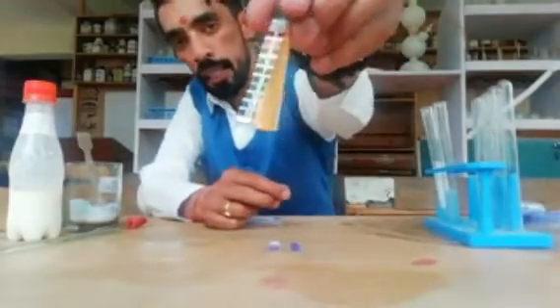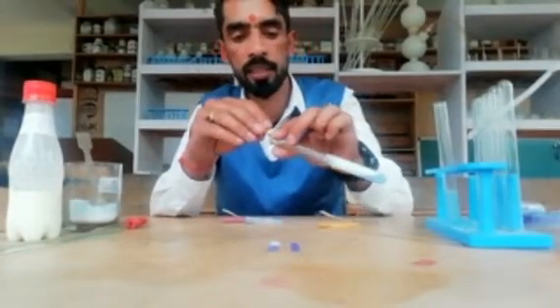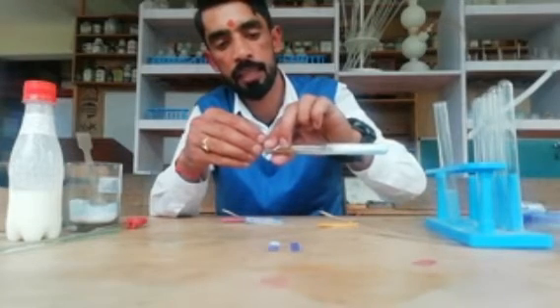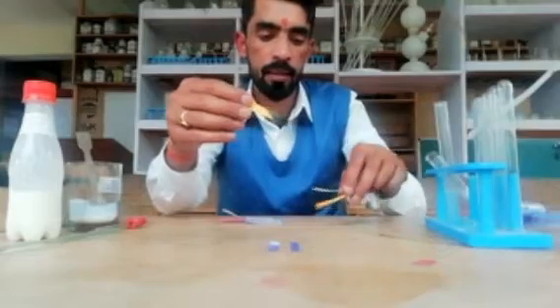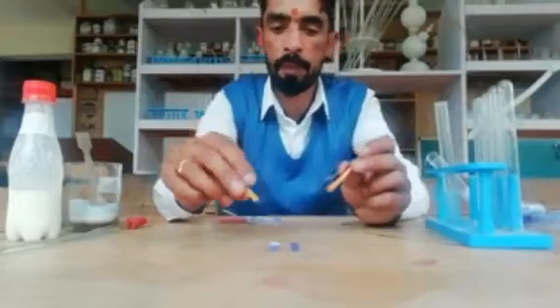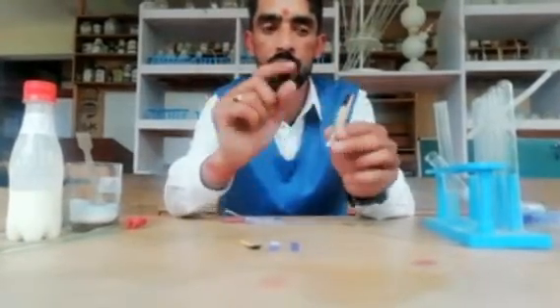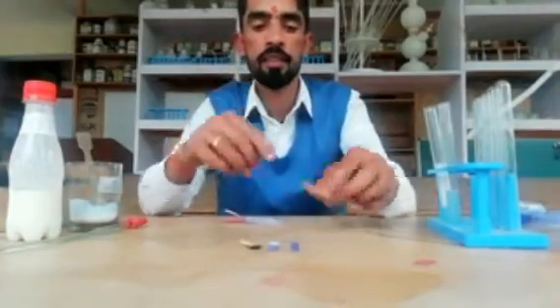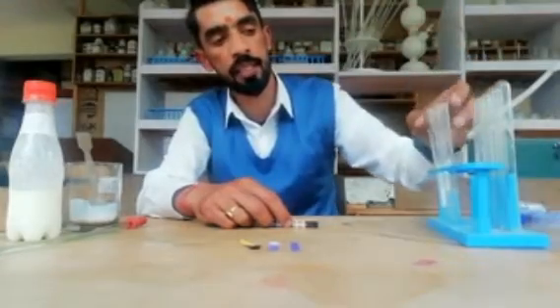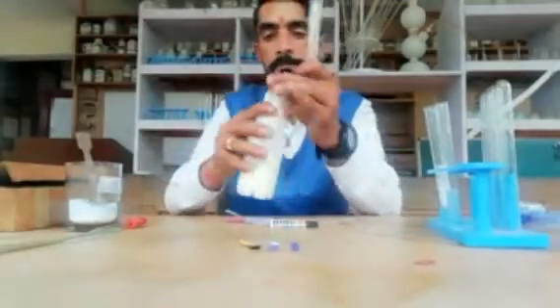Now we will check with the pH strip. Let me check — you can see it becomes a little bit green and then gives a purple color. The purple color value corresponds to between 12 and 14 on the pH scale. So the pH value of washing soda is between 12 and 14, which proves that the washing soda solution is basic in nature.